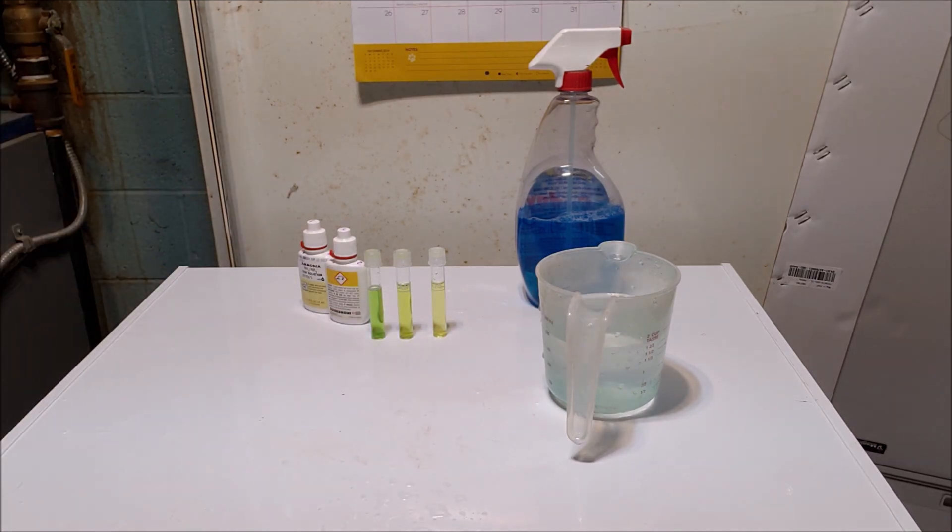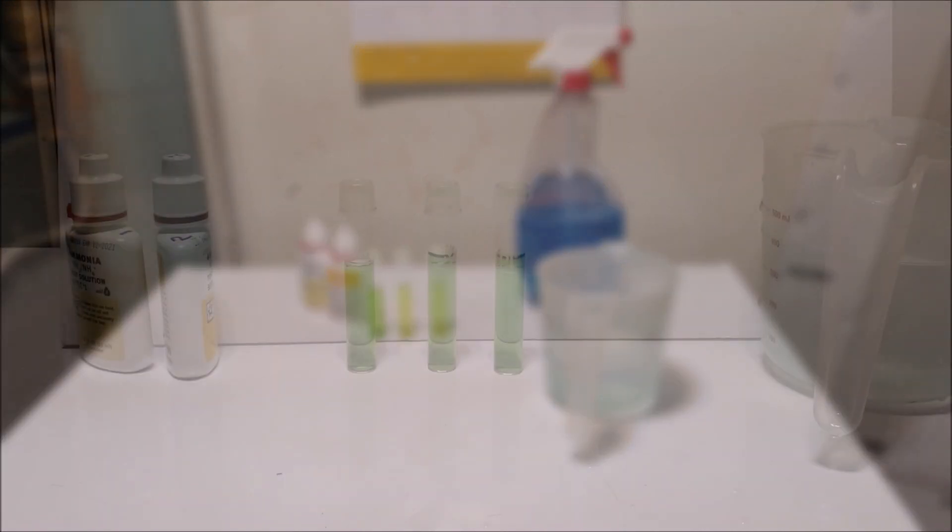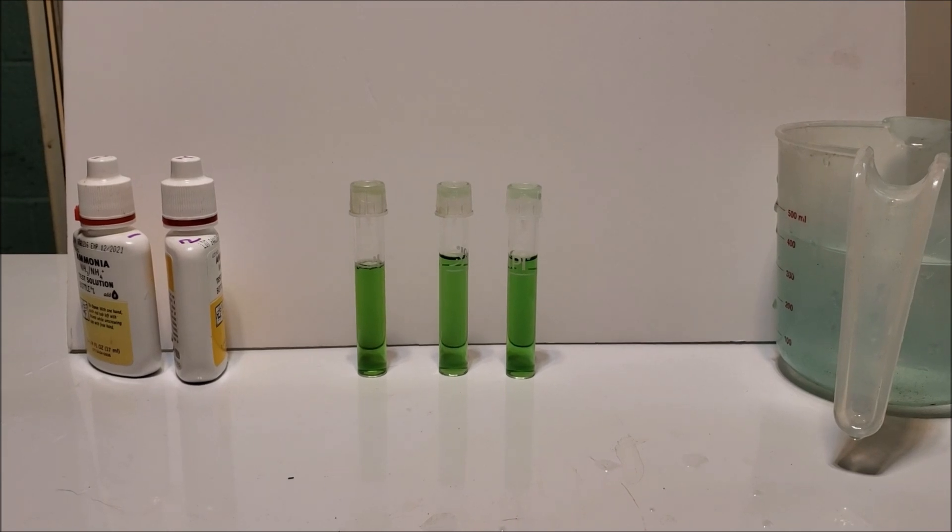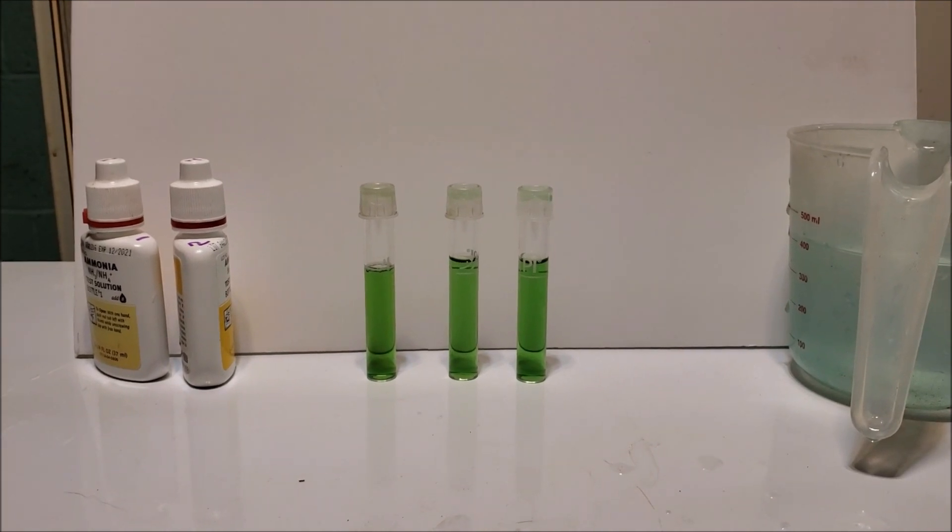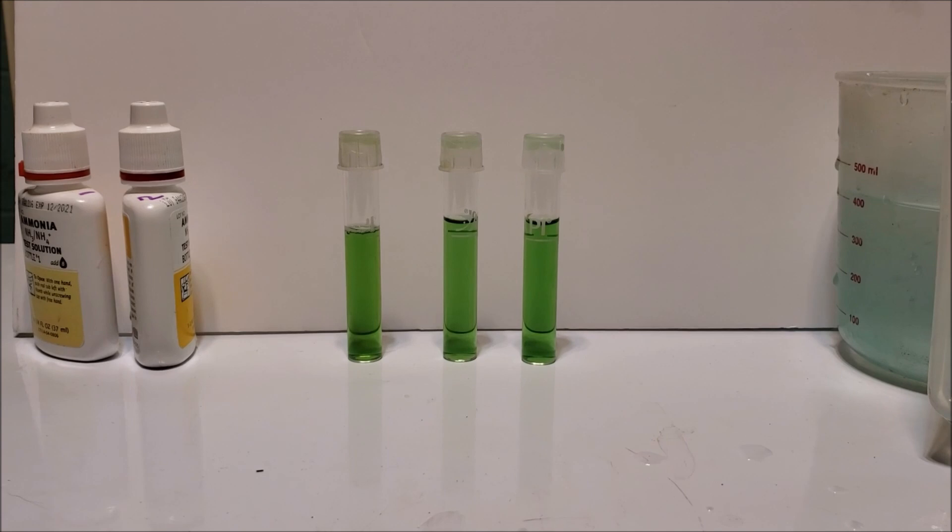We'll come back and we'll see if we've got different colors in all three of those vials. My prediction is that they will all be pretty much indistinguishable from one another. So there you go. Give me five minutes. I'll be right back and we'll see what the results look like.